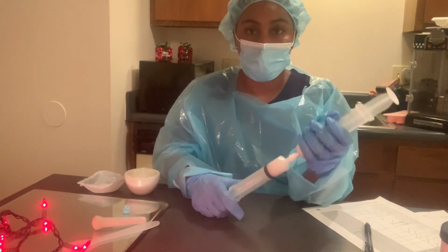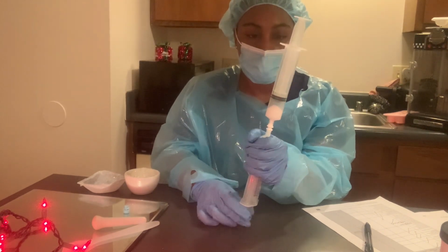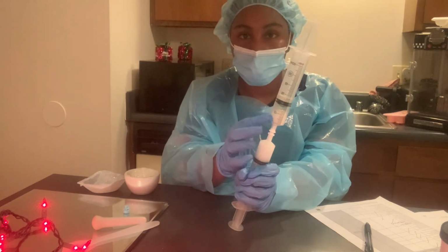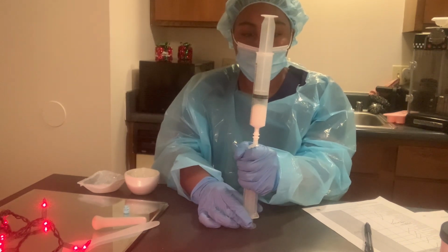Okay, so I got just a little bit in. Put some more.